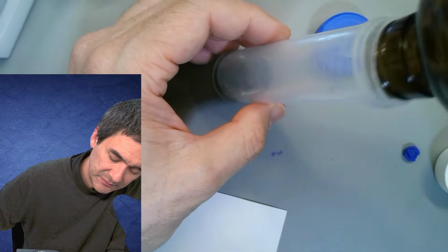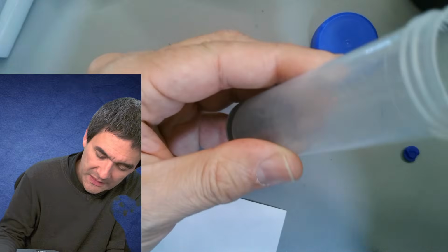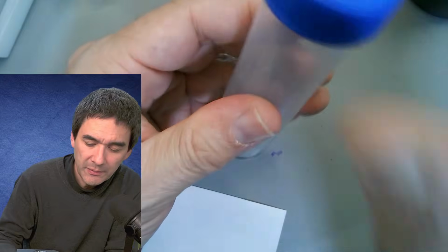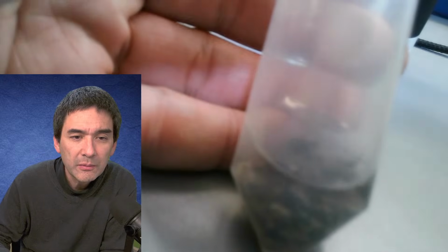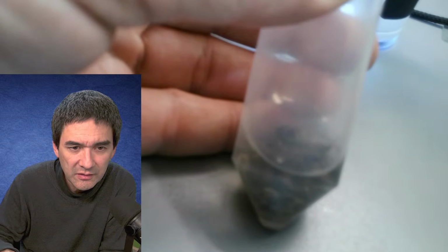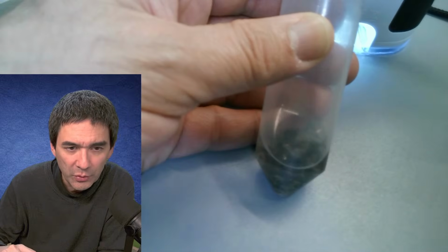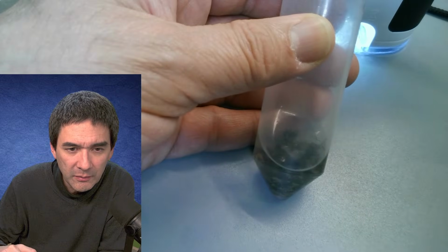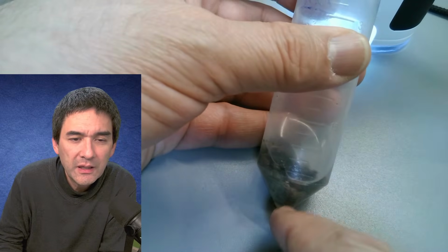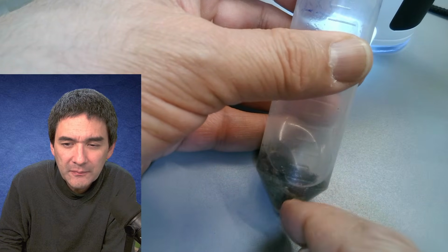So, I should probably have a little bit more. But what you're already able to see, let's put the cap on here, maybe you're already able to see something over here. I don't know if you're able to see that, but there are bubbles forming, and these are oxygen bubbles. I don't know if it's very clear or not. The focus is a little bit out of the focus range. But what's going to happen is it's going to start forming oxygen bubbles, and it's going to start breaking down everything that is organic.